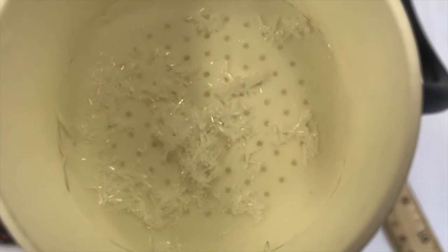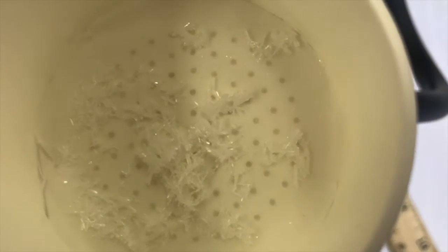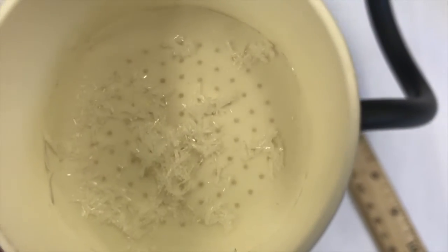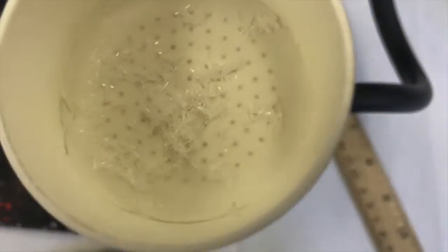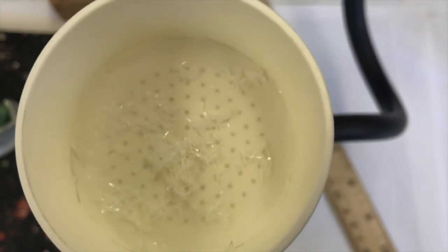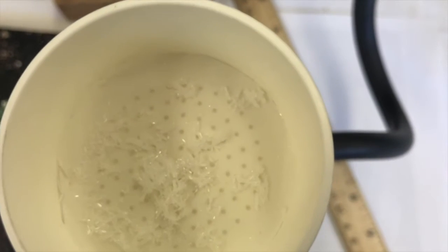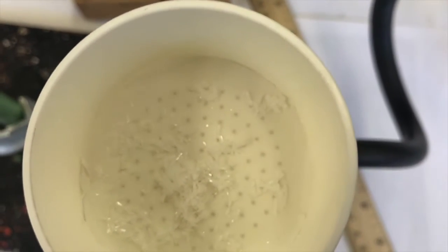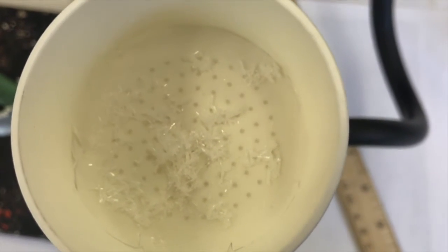I'm going to let this sit for about a minute under vacuum, and then I'll pull it out with the tweezers onto a watch glass, a clean watch glass. It doesn't have to be pre-weighed yet, because I'm just going to let it air dry. And this will air dry quickly because methanol has such a low boiling point. The last filtration we did was the precipitated orthotoluic acid from water, and we had to let that dry longer because water takes a longer time to evaporate.